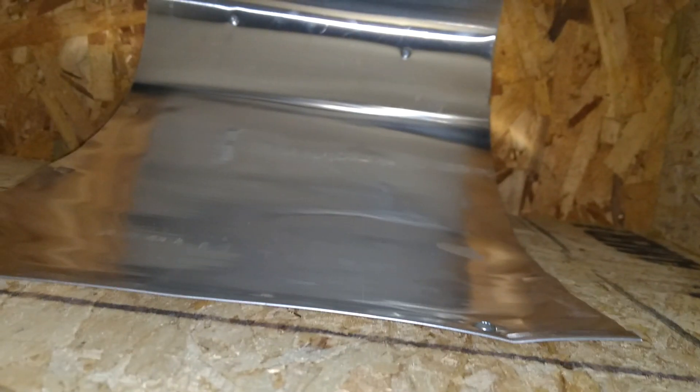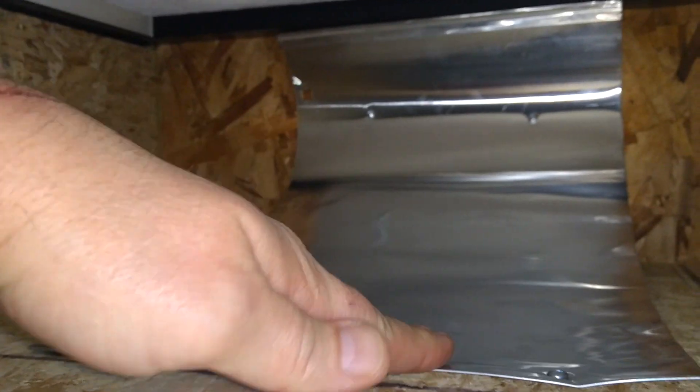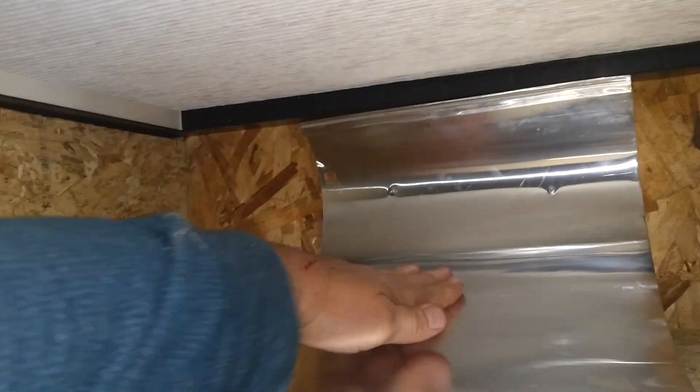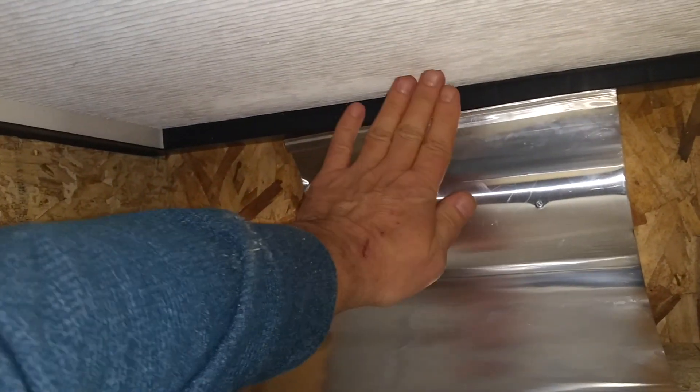The air blows down into the filter housing. I put this flexible ducting and I screwed it down to the bottom. The air will flow straight down into the filter as shown here. Down and up into the filter.